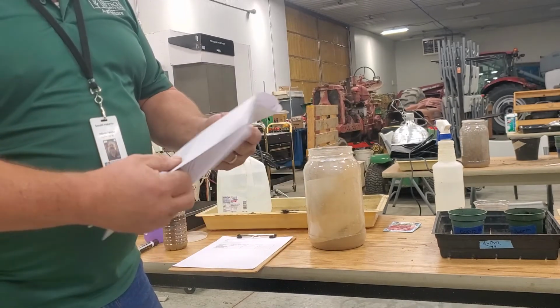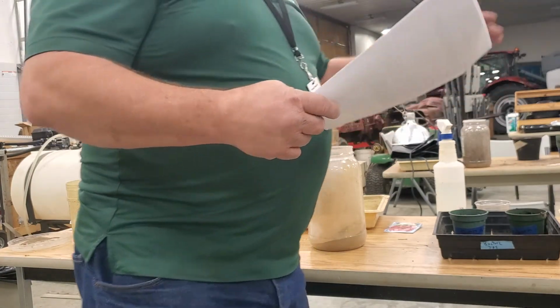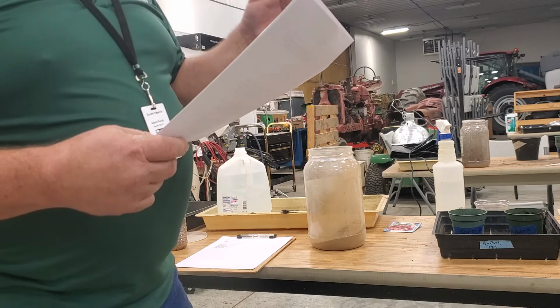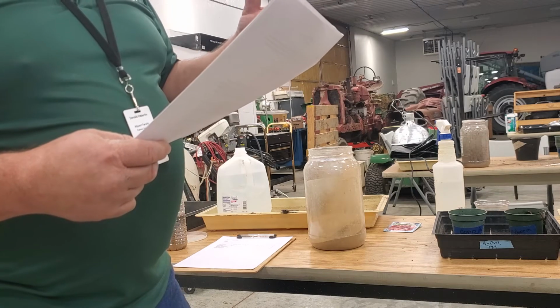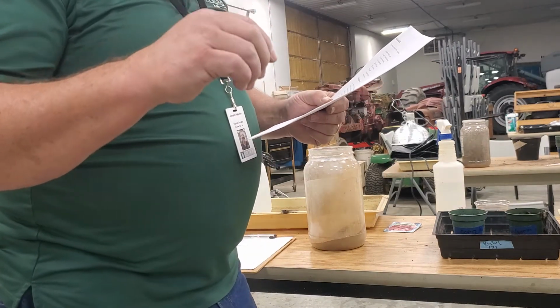It says it needs a pack of tomato seeds and green beans and corn. So I went with corn, soybeans, and radishes. Then you need 6 plastic cups, soil to fill the 6 cups, about 30 earthworms, tap water, 1 measuring cylinder, and a ruler.